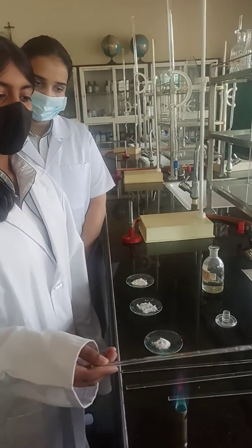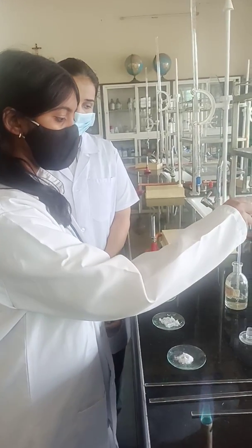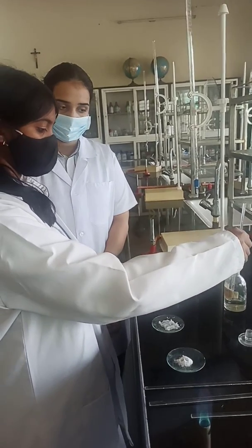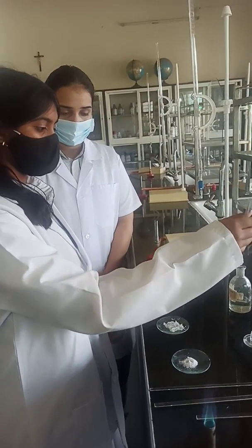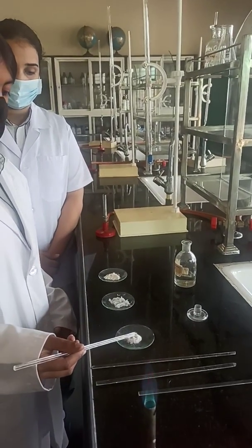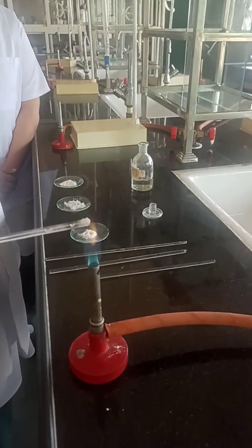What are you going to do? I am going to take a glass rod and then dilute HCl. You can take concentrated HCl as well — this looks like concentrated HCl. But dilute can also be taken. She has dipped the glass rod in the concentrated HCl and now she will stick some flakes of the salt on it and introduce it to the flame.